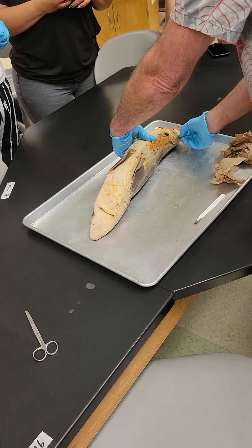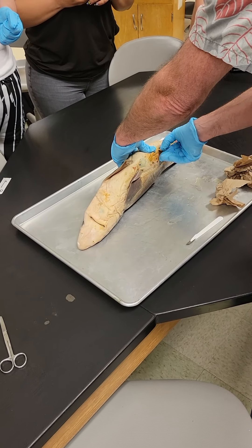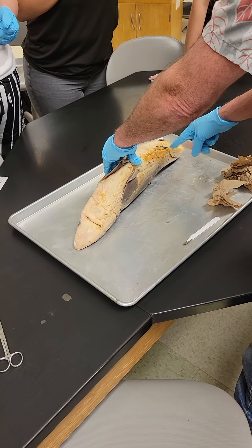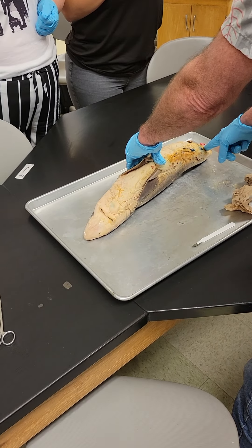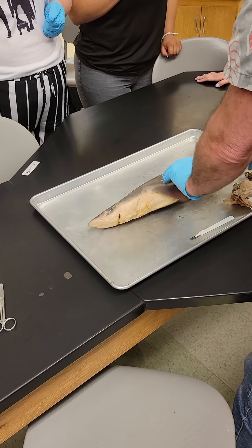I can tell it's a female — males usually have a little finger down here to transfer sperm. When they catch these, they basically inject them with latex: blue for the veins, red for the arteries, and yellow for the hepatic portal system.